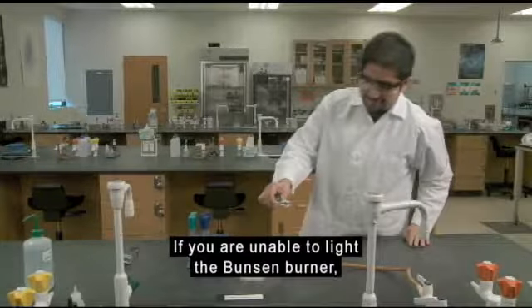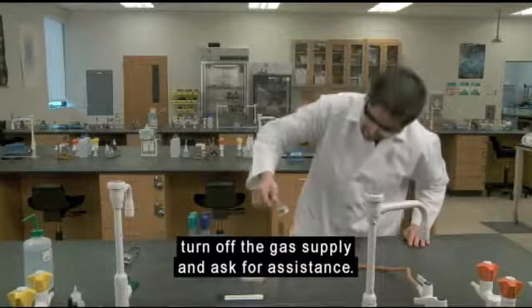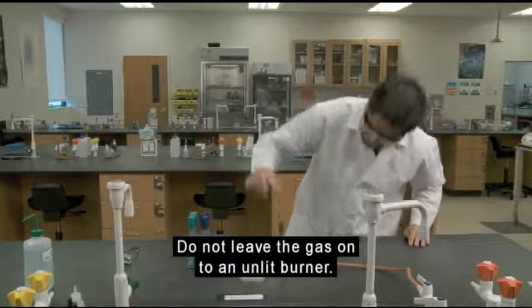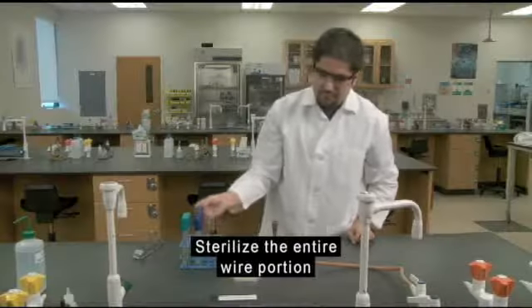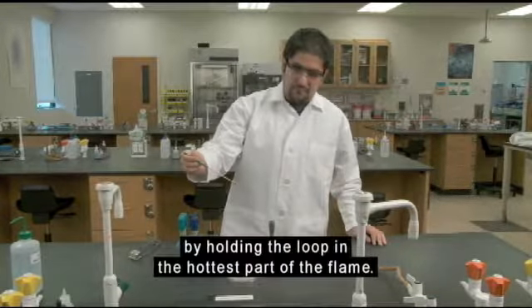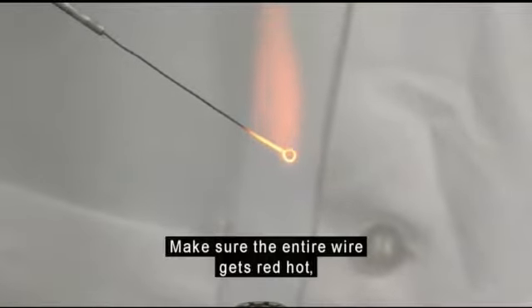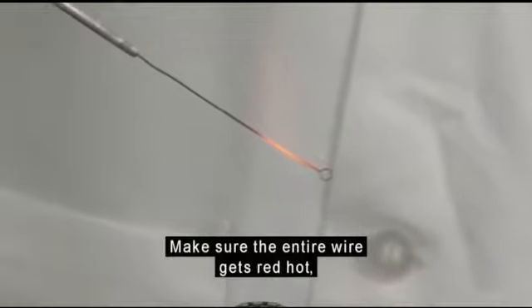If you're unable to light the Bunsen burner, turn off the gas supply and ask for assistance. Do not leave the gas on to an unlit burner. Sterilize the entire wire portion of your inoculating instrument by holding the loop in the hottest part of the flame. Make sure the entire wire gets red hot, not just the tip.